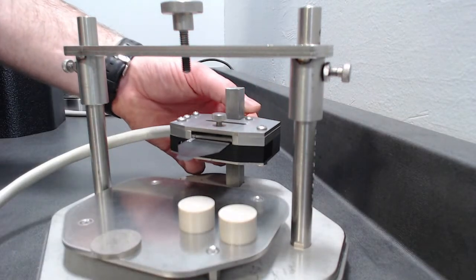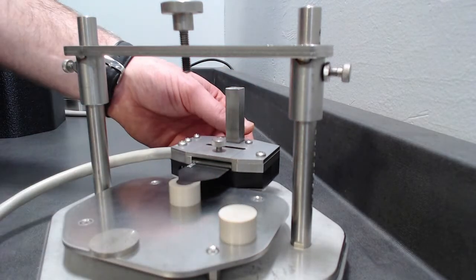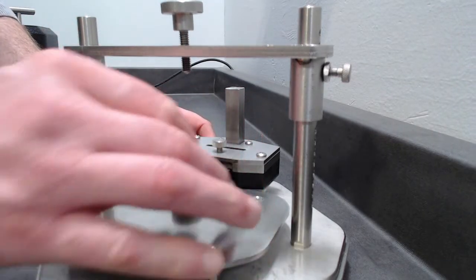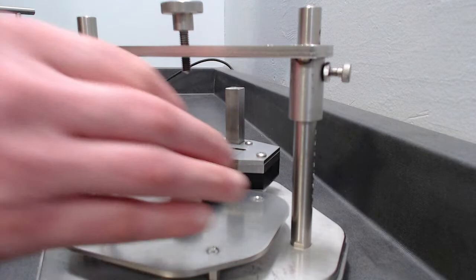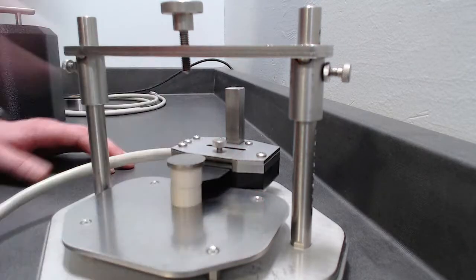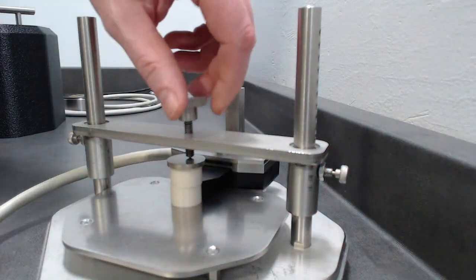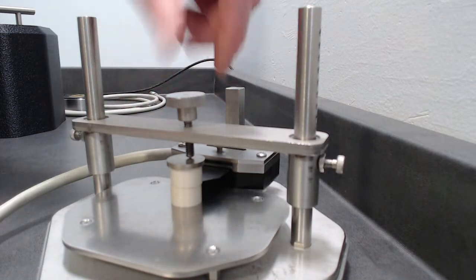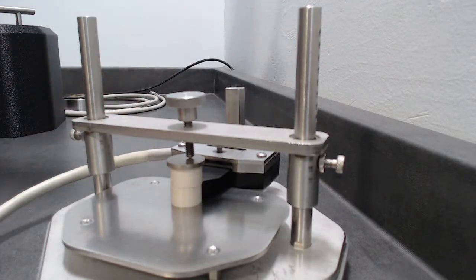So we can change the height of the sensor by moving it up and down. So we're going to do a symmetric test. So we're going to put one sample piece on the bottom and one sample piece on top. So that's our configuration. We're going to introduce just a plate so that we're not scarring our sample. And then we're going to lower the top plate till it's approximately in the right location, and then just on a smaller scale, just tighten it there. That's it. That's your complete configuration of sensor to sample. So now we can go back to the software.